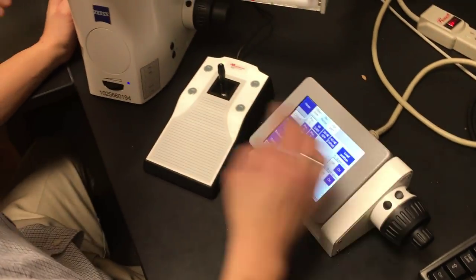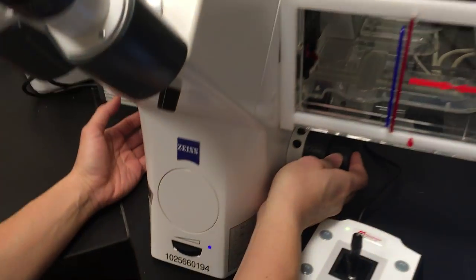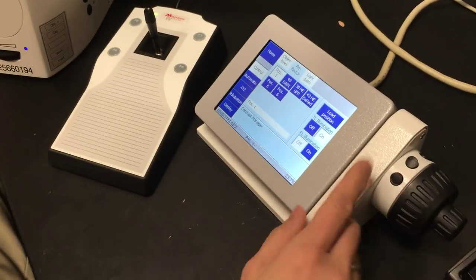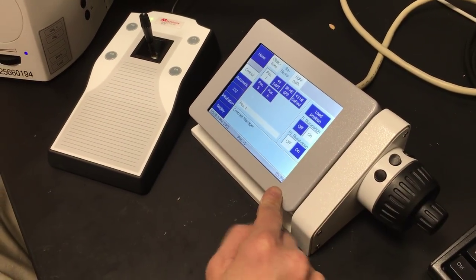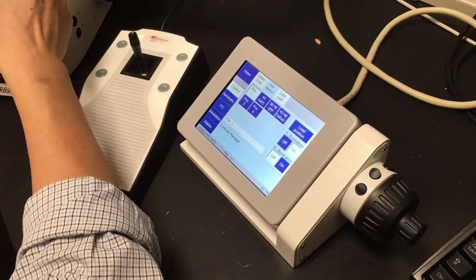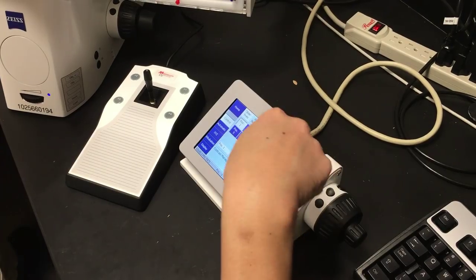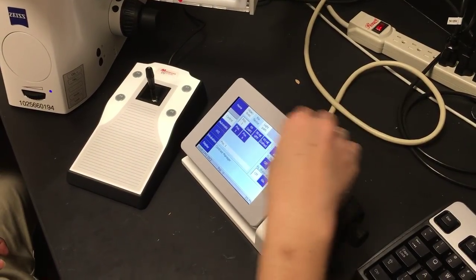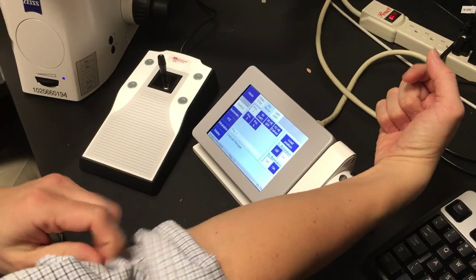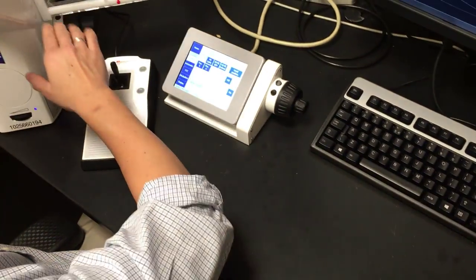You can focus with the joystick or the knob over here—coarse focus, fine focus, same thing. The beauty of this is it can be attached to the side of the microscope, but because of the incubation chamber it won't fit, so you have to put it on the table. Having this gives you the option of working off the screen—you can now focus here without having to look through the microscope, which is kind of nice.